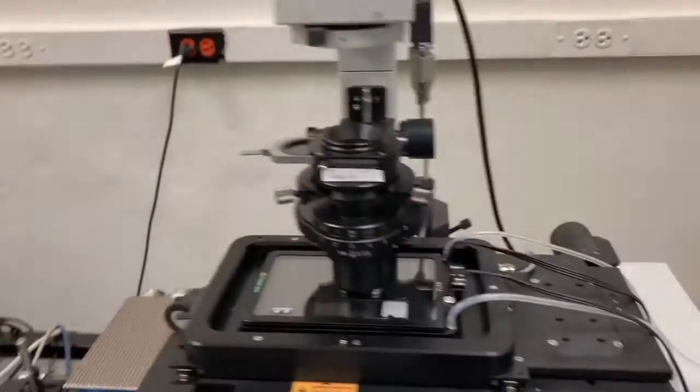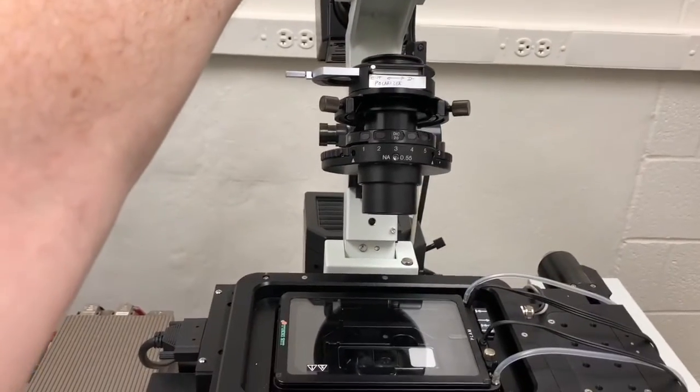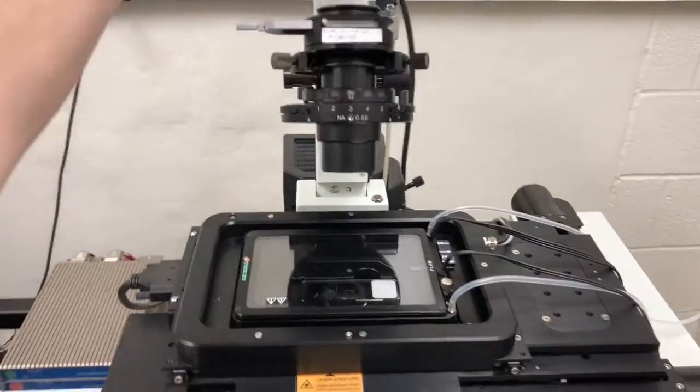The second is we need to make sure that this arm is lowered. If it's in this position, the lasers will not turn on. There's a second interlock that controls that.